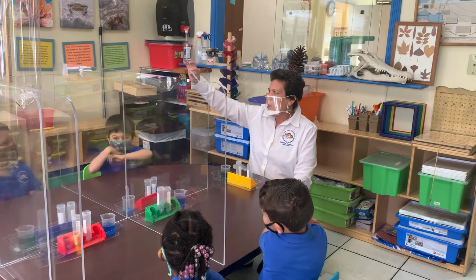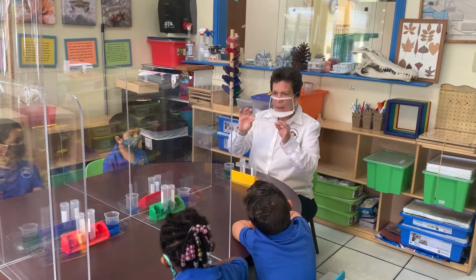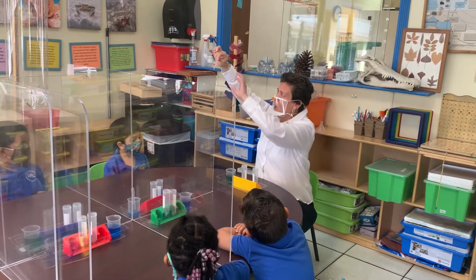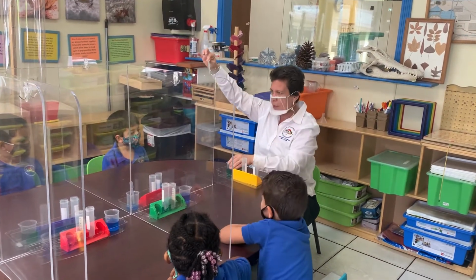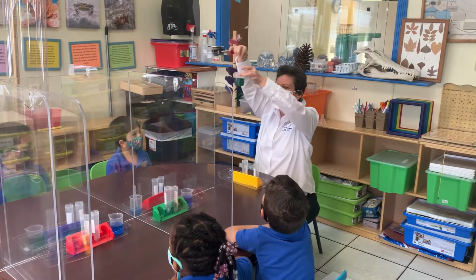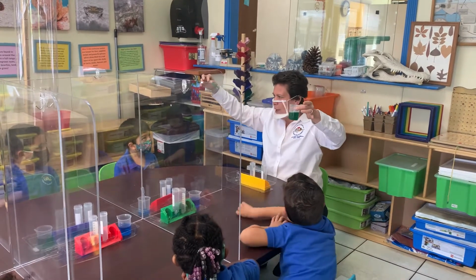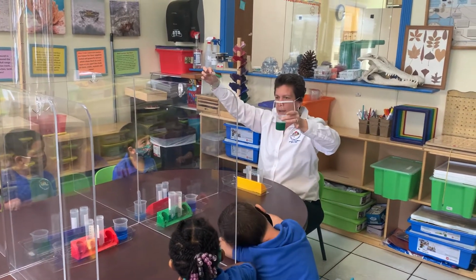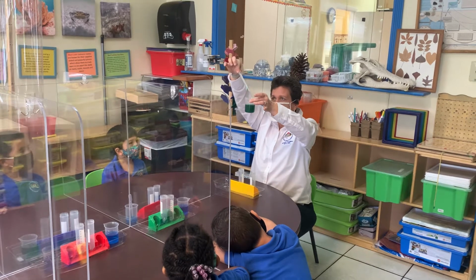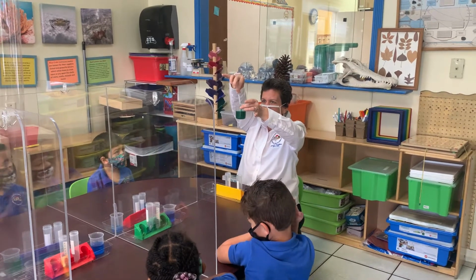All right. How a dropper or a pipette works is there's air all around us. Okay? And this pipette, this dropper, is filled with air. When I press it, all of the air pushes out. So now when I press it, I push the air out and I'm going to put it into the beaker, and look what happens when I let go. The air from the outside of the room is pushing the liquid into the pipette. Now watch what happens when I squeeze it. I can push it out. Okay, so I squeeze it first, I put it in, and then I let go.